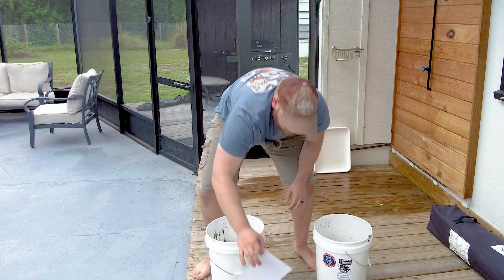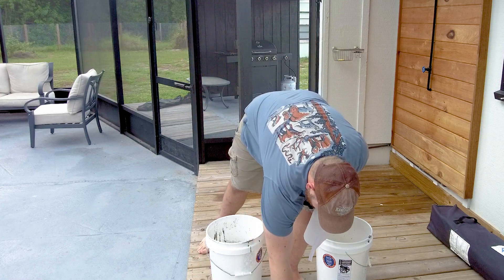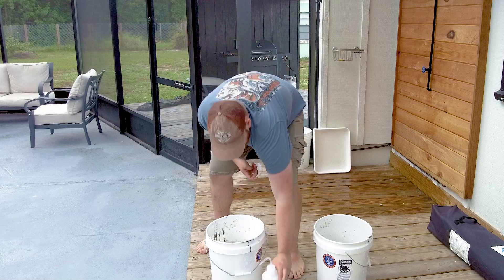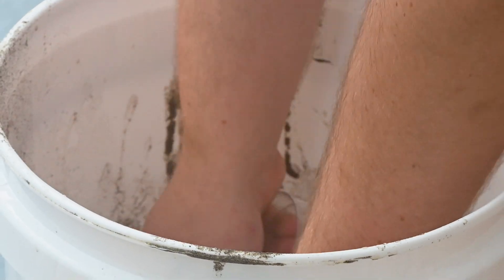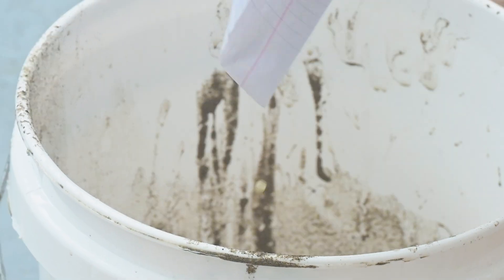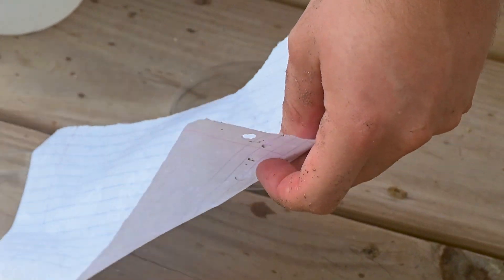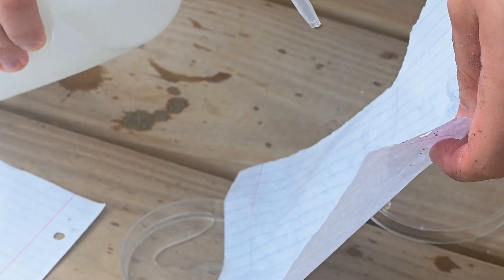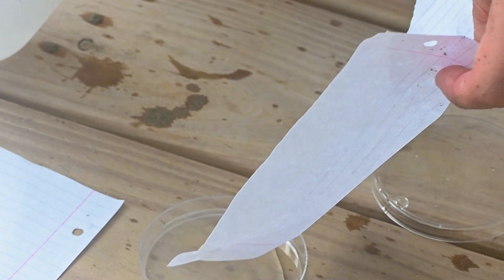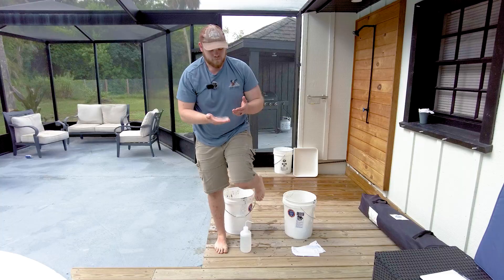You're then going to take a clean, dry sheet of paper and some seawater and any container. Take your paper and gently blot it over the bubbles. Place the paper over the container — kind of make a little taco or funnel shape — and then use your seawater to wash anything on the paper into the container. Only use a sheet of paper one time. There's our extracted sample — let's go see what's in it.